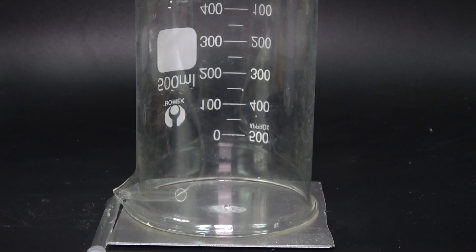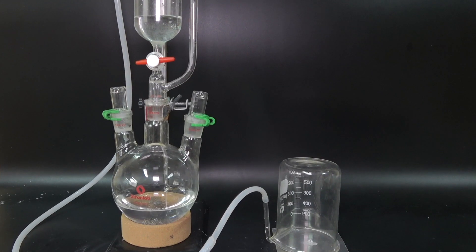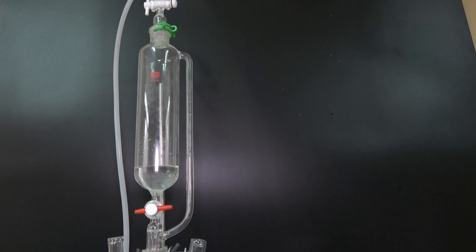Well, there is only one way to find out. So I came up with this apparatus that would deliver pure oxygen at a steady rate.